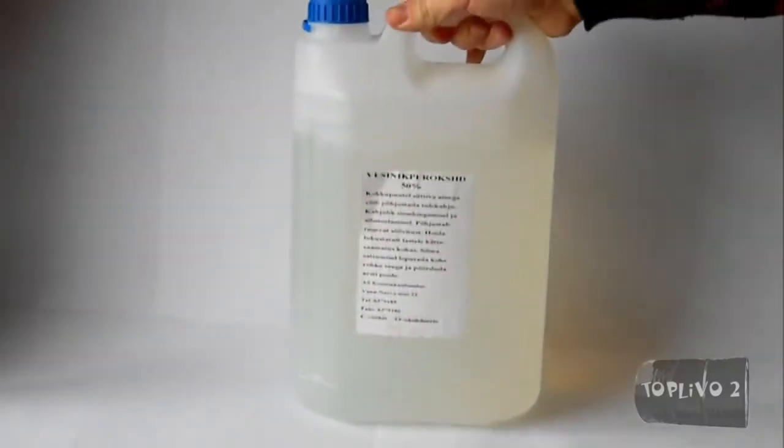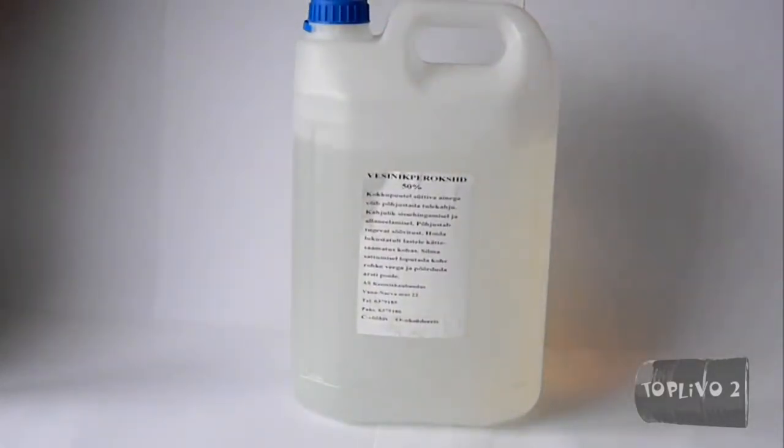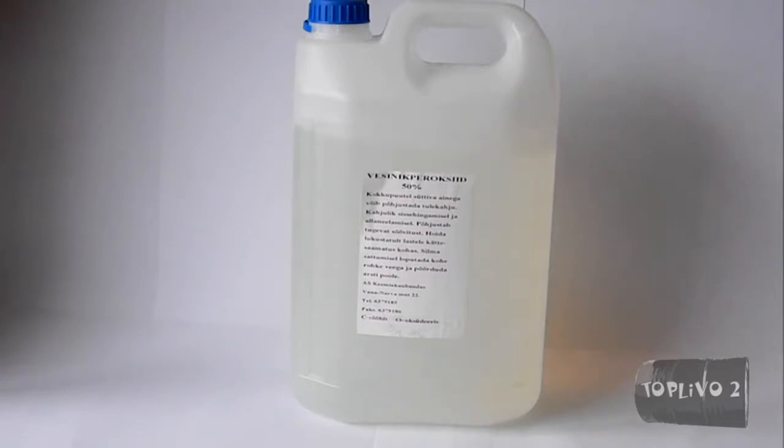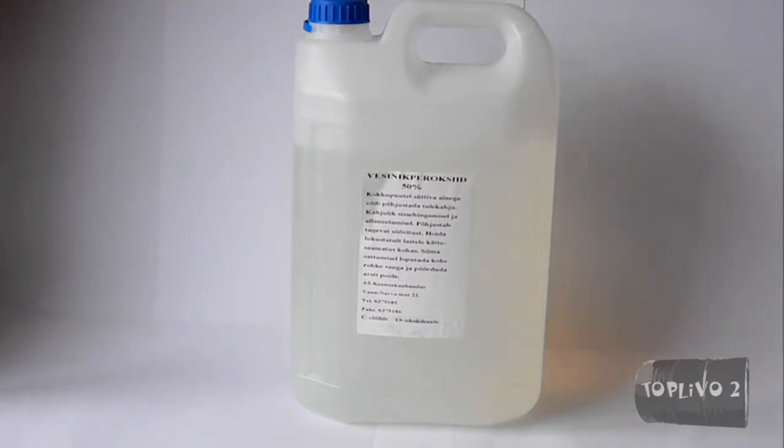Hello everyone! Today we'll consider the decomposition of hydrogen peroxide in the presence of catalysts. I recently bought a full canister of 50% hydrogen peroxide, and I think I will not have problems with that.